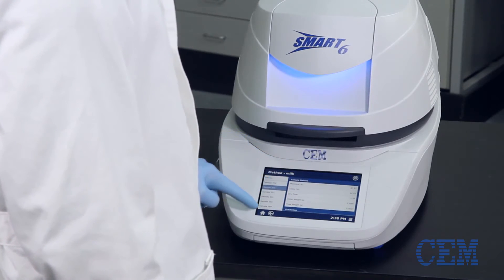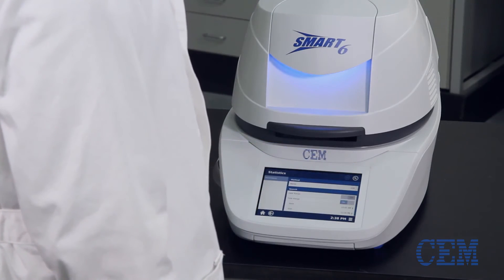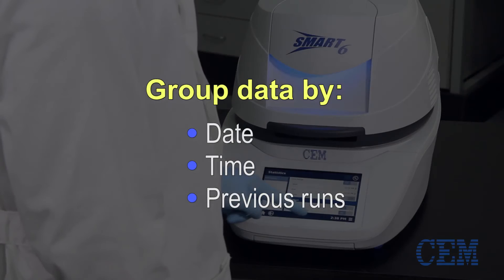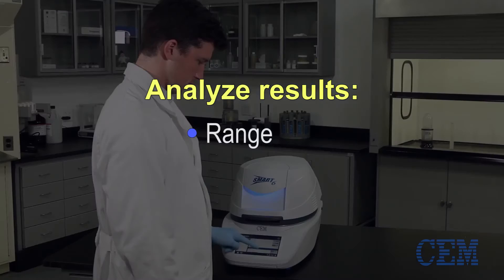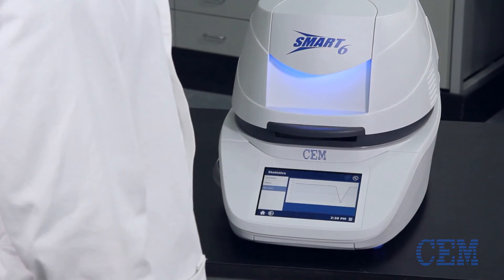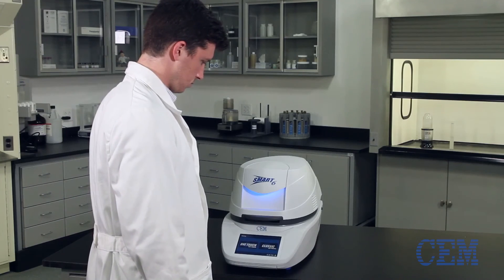If you wish to analyze a group of tests that have been performed under a given method, choose the graph button in the top right corner. Data can be grouped by date, time or even the last 10, 20 or any other number of previous runs. Statistical results such as range, standard deviation and averages can be viewed and graphs of the results can be displayed. High and low limits can be set on each graph to quickly determine if samples are out of spec.